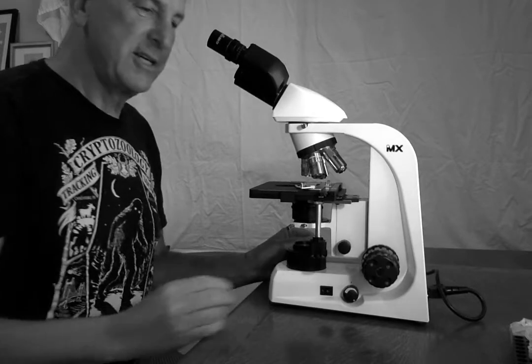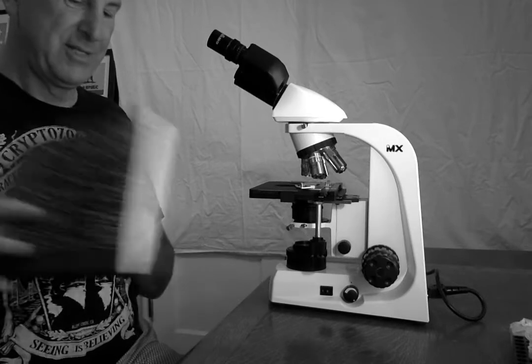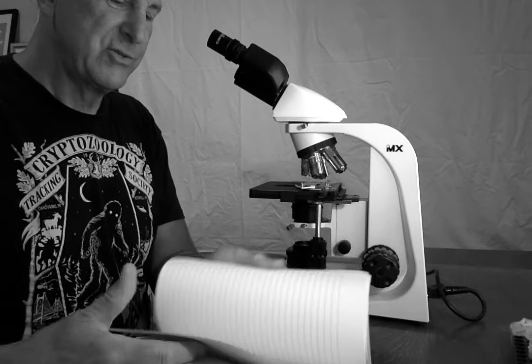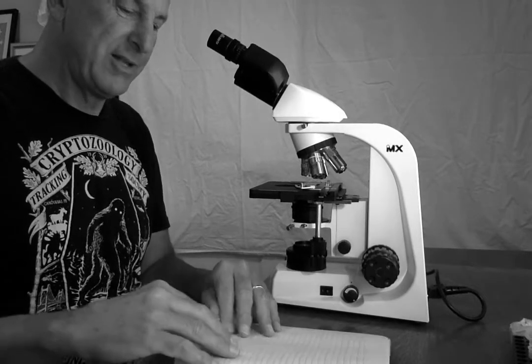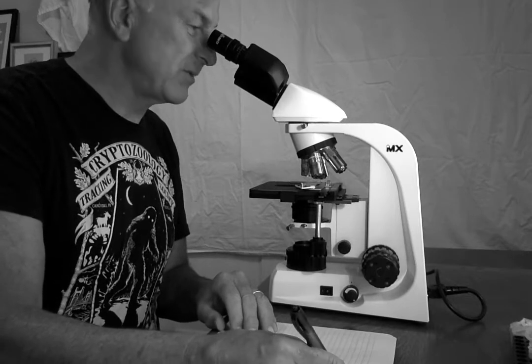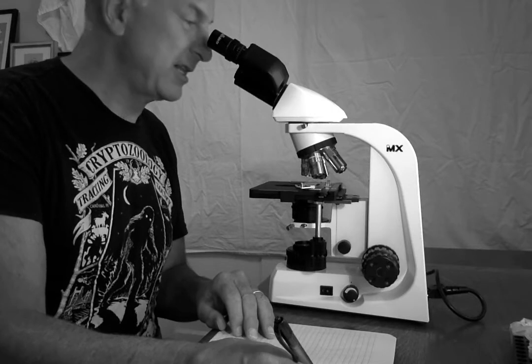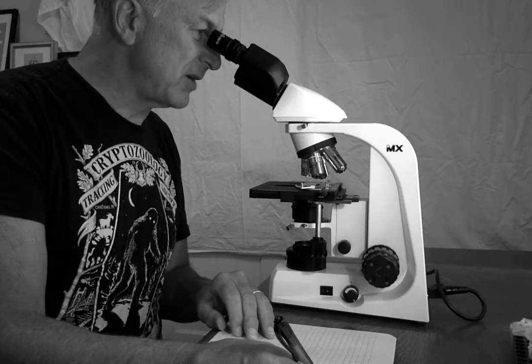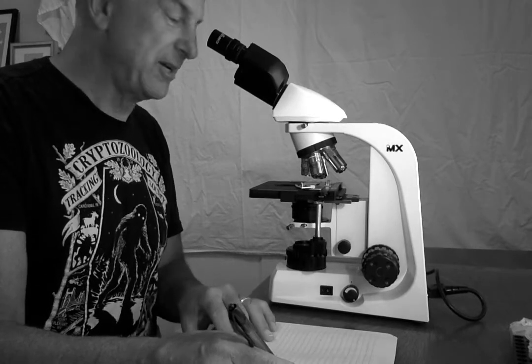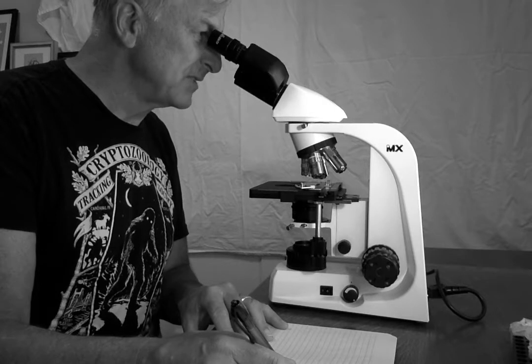And if I think it's time to record what I'm seeing, I'm going to keep my science notebook handy, and I am going to draw what I see while I'm working. I'm not going to try and remember. So if I want to write down things I'm noticing, things that seem important, I'm going to write while I look. If I want to draw what I've seen, I'm going to make the drawing while I have it under the scope, so I draw what I actually see, not what I remember.